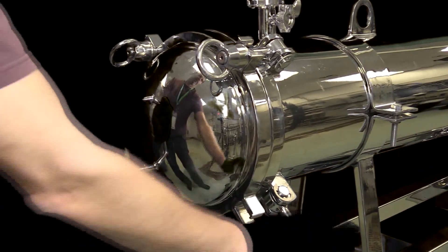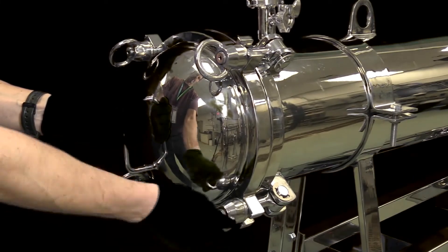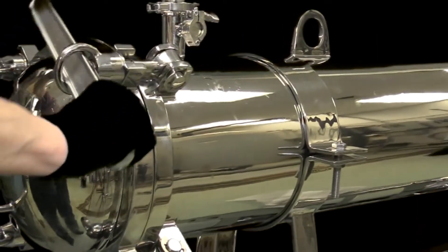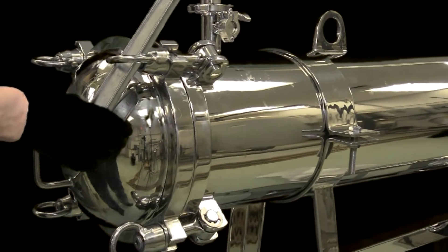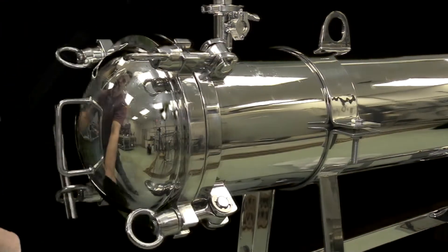Then, use a rigid bar to tighten each clamp by roughly one quarter turn until the housing lid contacts the housing.